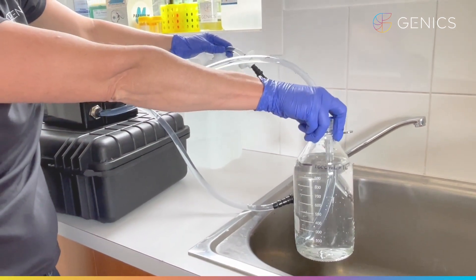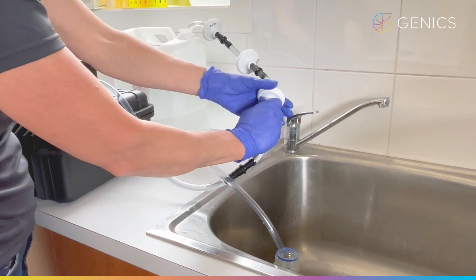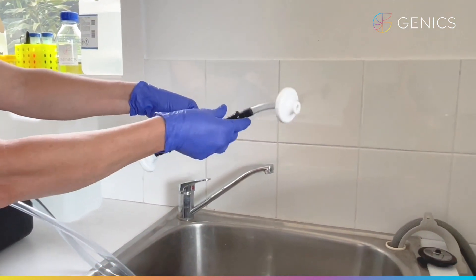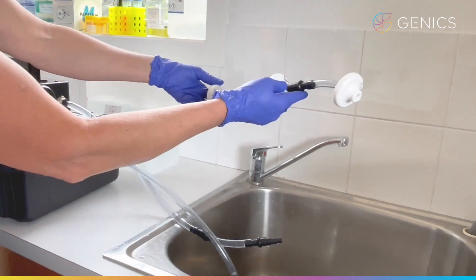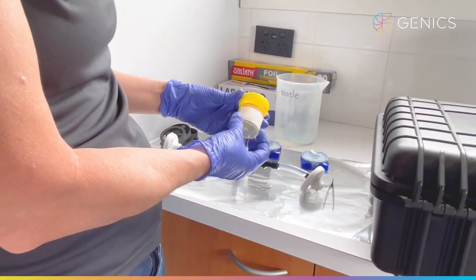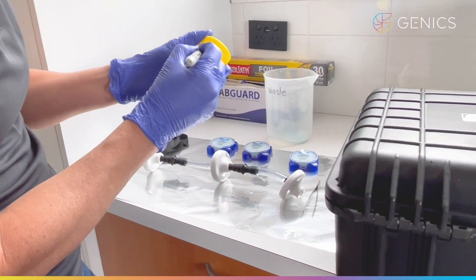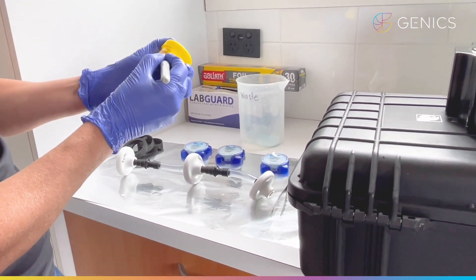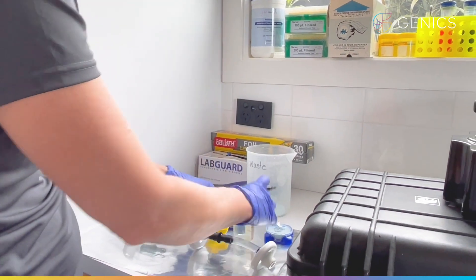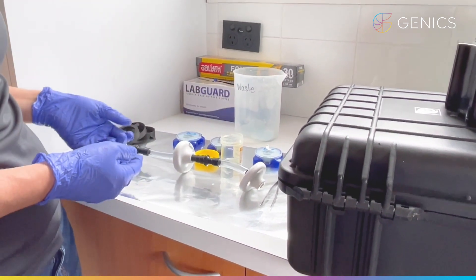We have reached the one litre mark on the filter. We then need to disconnect all of this — we are wanting now to collect our white filter cartridges in line. We remove the connecting parts and take this back over to our foil to put the filters into our sample container. Over here we have our water sample. We then need to take a sterile container, like these yellow cap containers, and write the information about what our sample is — in this case, tank water from the intake, tank 27, and then we also write the date. So this is ready to receive our filtered material. The next step is to get our filters out of these cartridges in a sterile manner and pool those into the sample container.